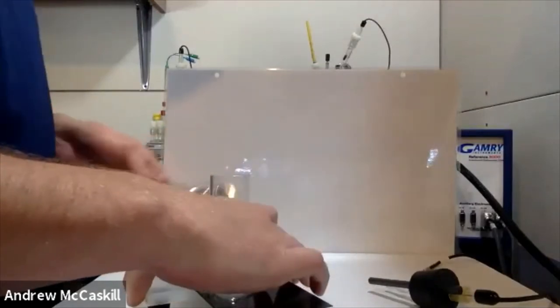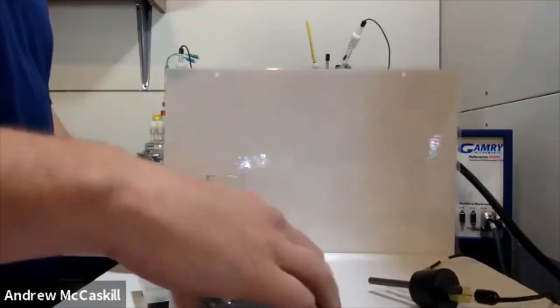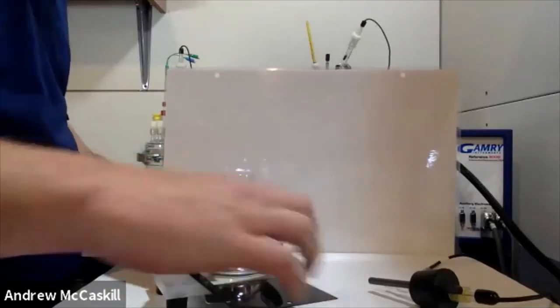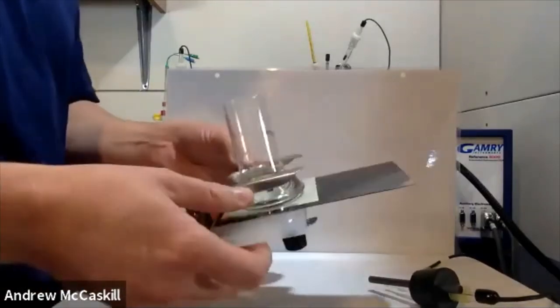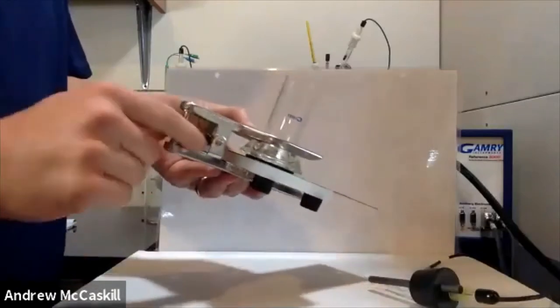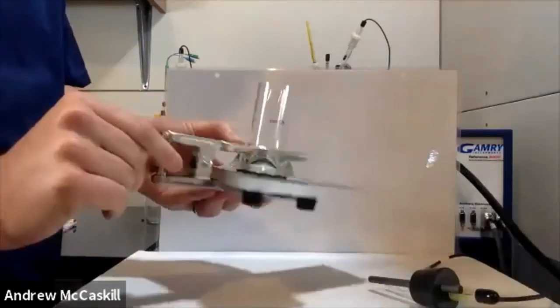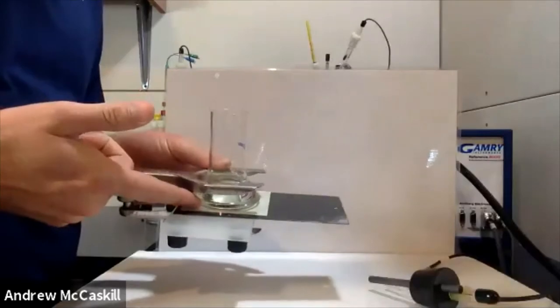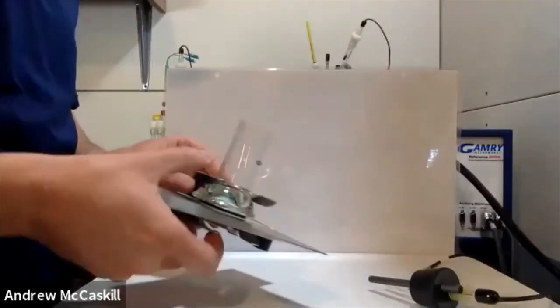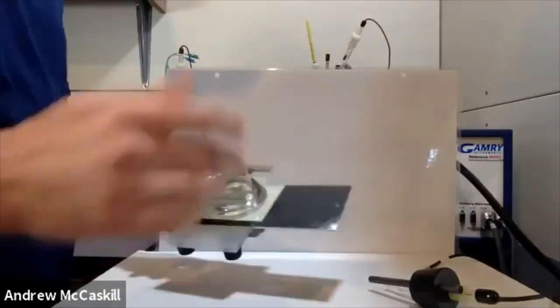We have this clamp to create a seal on the bottom. The clamp fits on like this, and you screw it down to apply some pressure. Now we should have a seal at the bottom and I should be able to pour electrolyte into the top of this.